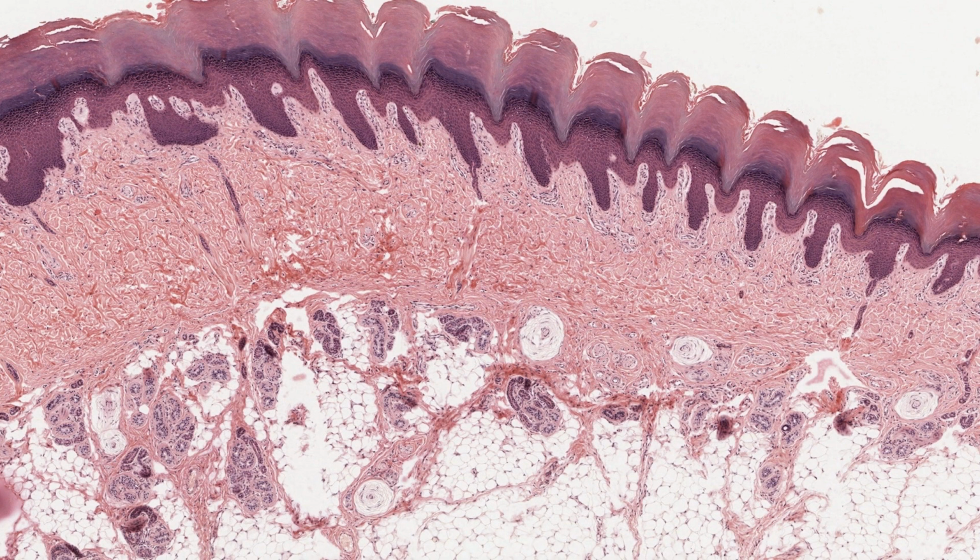Thick skin is on the surface, defined by this thick layer of epidermis, covered by a thick layer of keratin. The ducts of the sweat glands are these very thin, dark-stained lines that extend from the epidermis deep down into almost the junction between the connective tissue dermis, this light pink region, and the hypodermis, which is essentially adipose or fatty tissue. At the base of the dermis, they start coiling and then change abruptly to secretory portions.